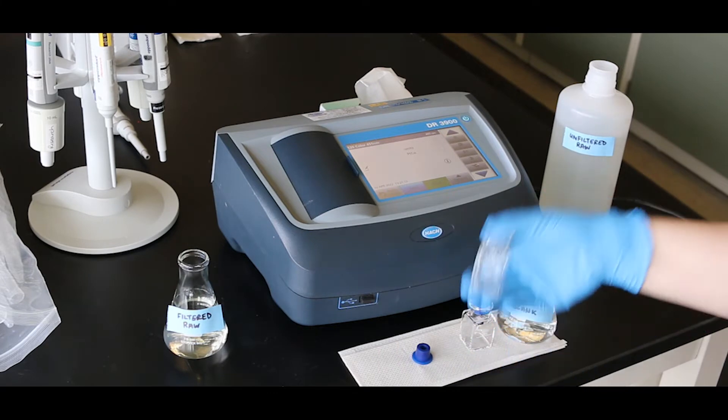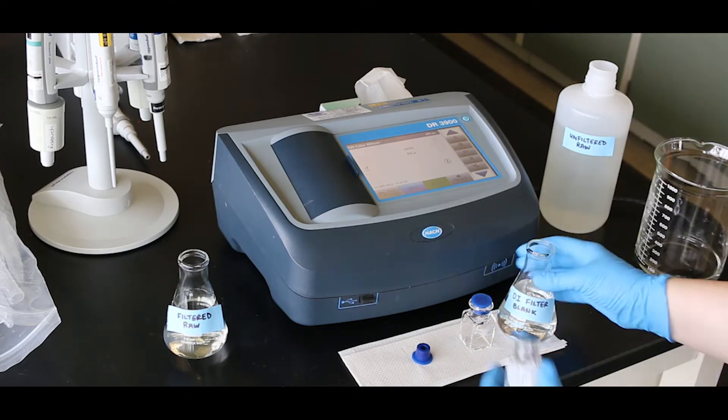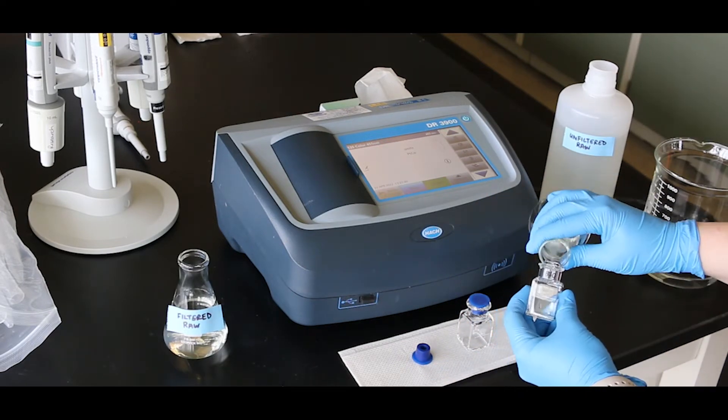Prepare the blank. Rinse and fill the blank cell with filtered deionized water. Make sure to clean the outside of the cell before placing it in the instrument. Press zero on the instrument.